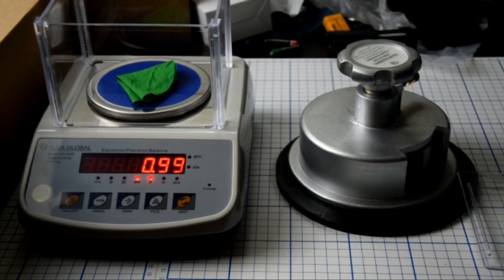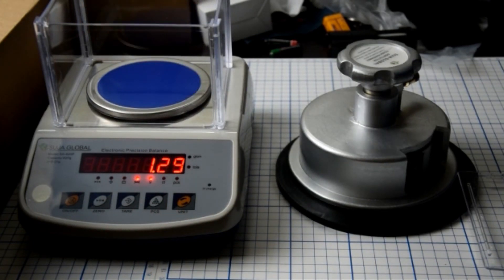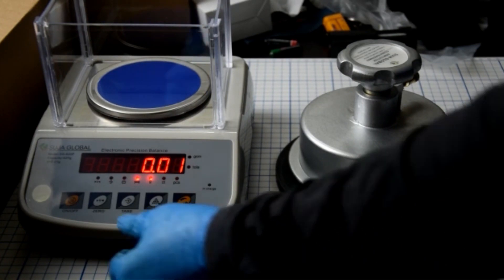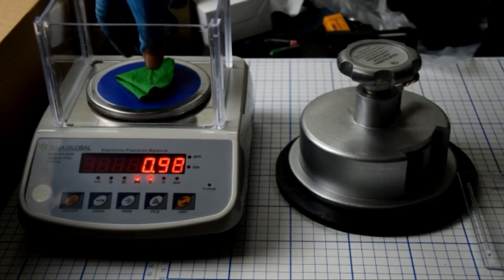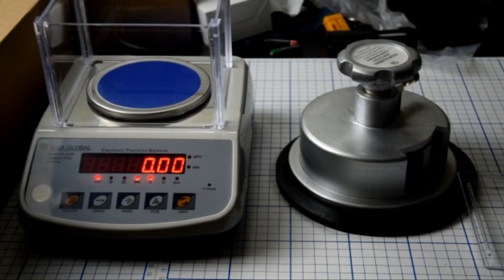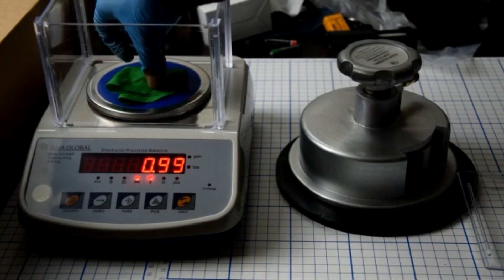It's not 100, it's 99. It's changing because air comes with my hand, this is why it's changing. You can change it from grams, 0.99 grams, but always change it to GSM. It's 99, because the precision is 0.01 plus or minus.